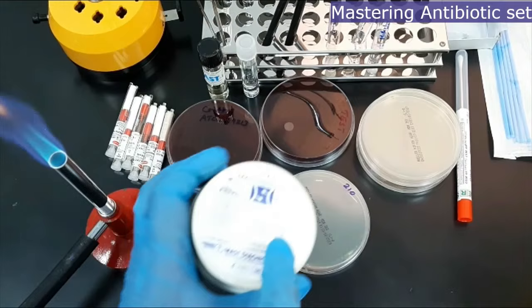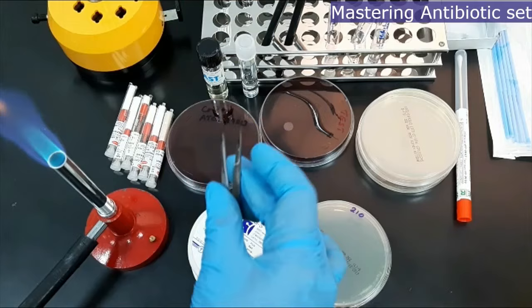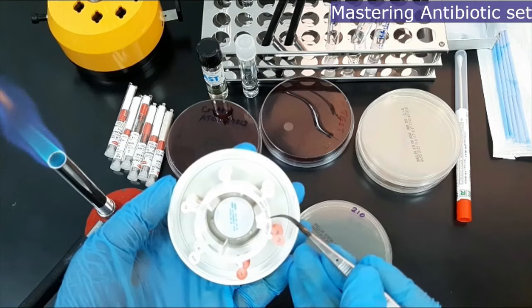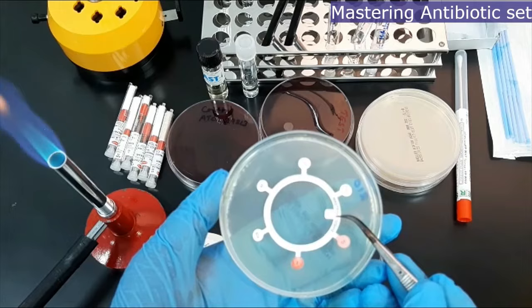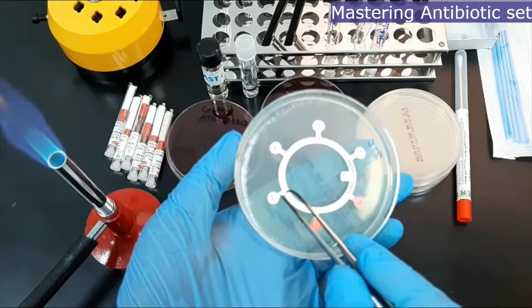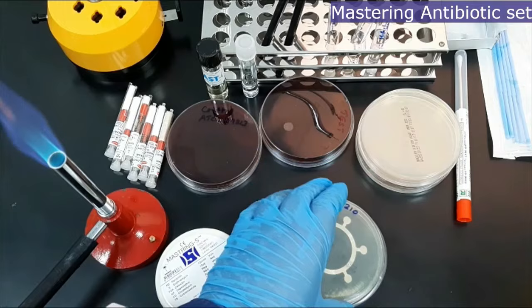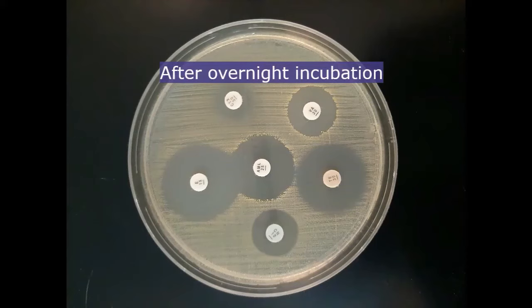Now, the placement of multiple antibiotic discs on a swabbed agar surface will be demonstrated. Repeat all the procedures as before and pick up the multiple discs with the help of sterile forceps. Transfer the multiple discs to the swabbed agar plate and lightly press down to ensure contact with the agar.